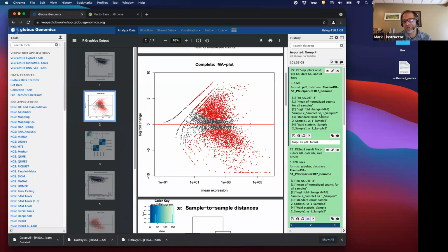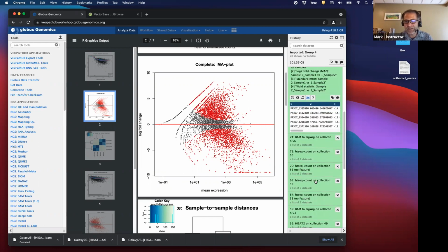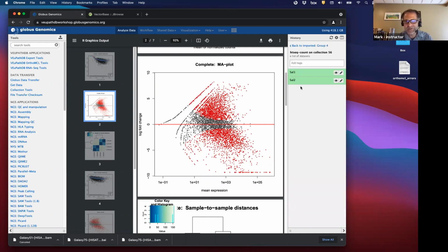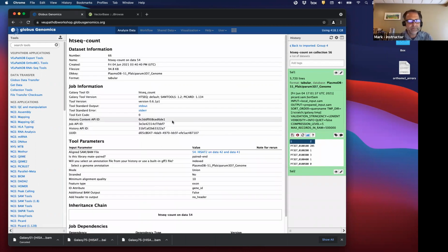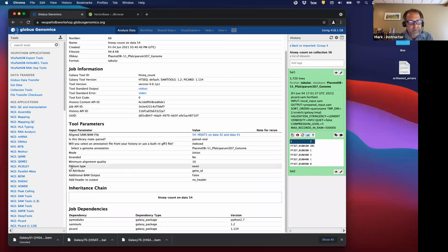And for what you're talking about, quantitating reads that are in the promoter or upstream region, people sometimes make their own GFF files and use that for HT-seq analysis, and call that region in the GFF file upstream or something, and then specify in the parameter for HT-seq, which is, I'll show you. This is the feature type, what do you want to count? It would be your upstream, whatever you name it in the GFF file. And you can do that.